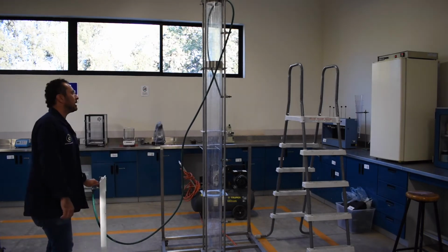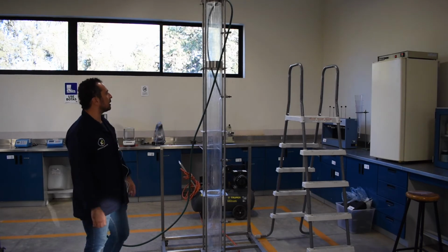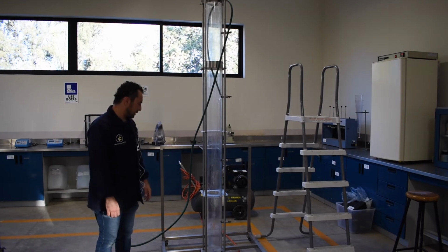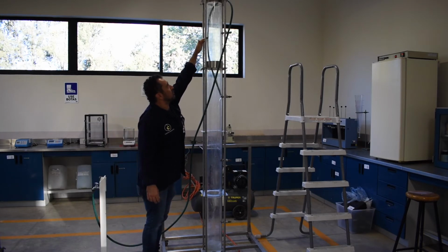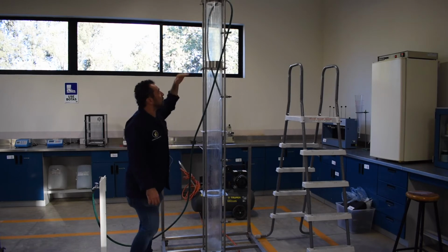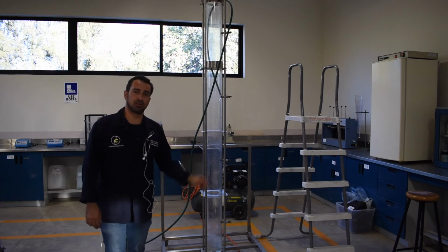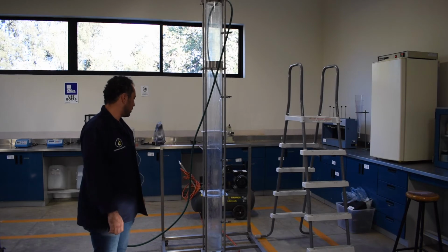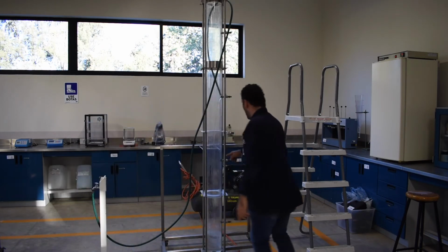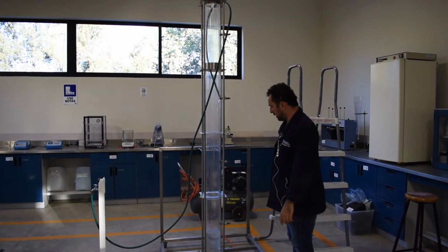We proceed to fill it in. It might take around 20 liters of wastewater in order to fill up to just right above the 4th port. You don't want to overfill, because then once we air it up, it's going to create an overflow of our water. Make sure all the ports are closed prior to filling it in.